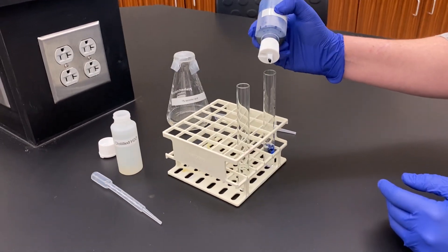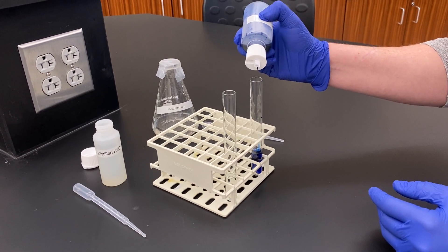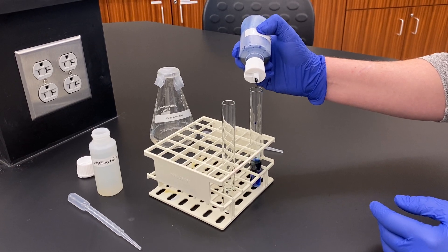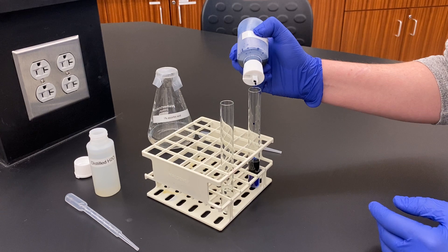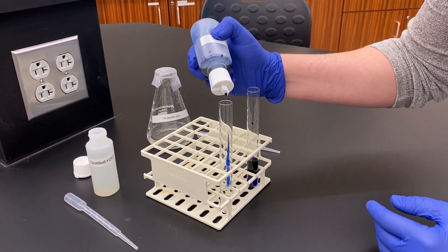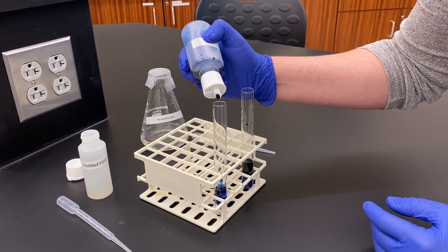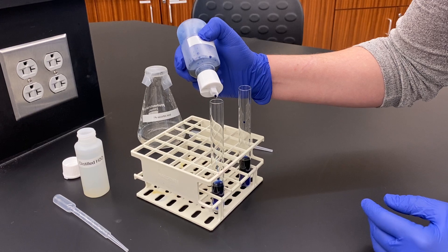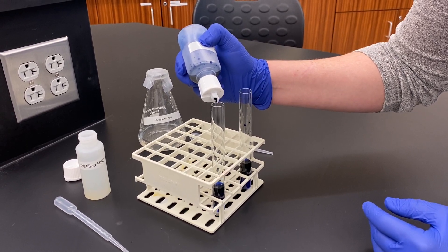Counting 20 drops into the first tube, then 20 drops into the second tube.